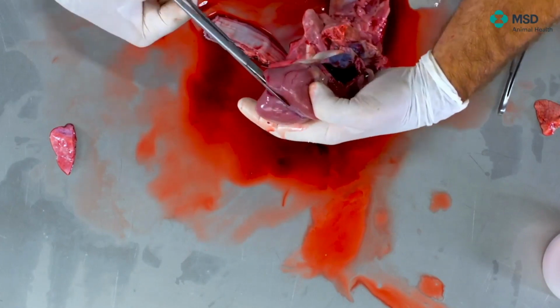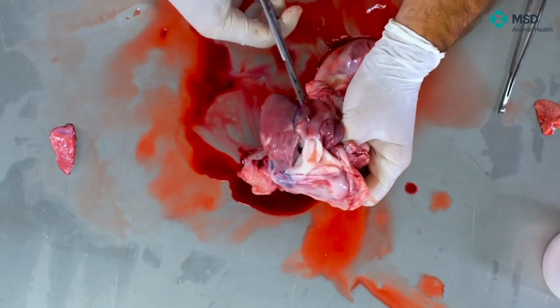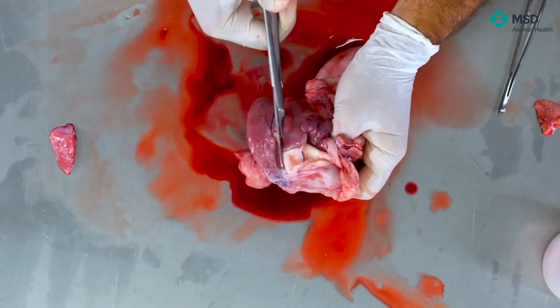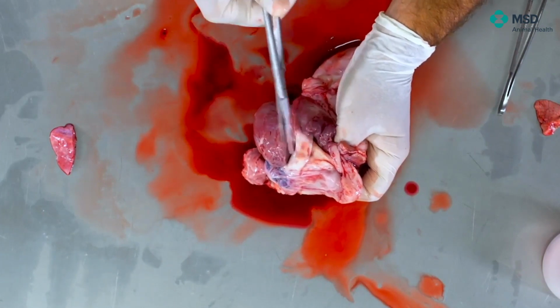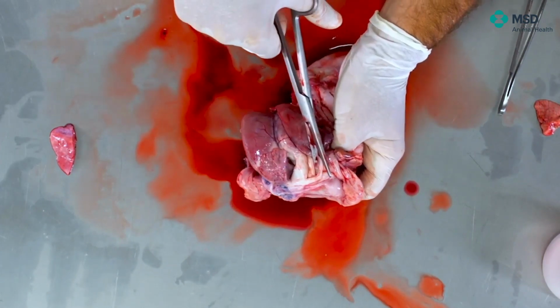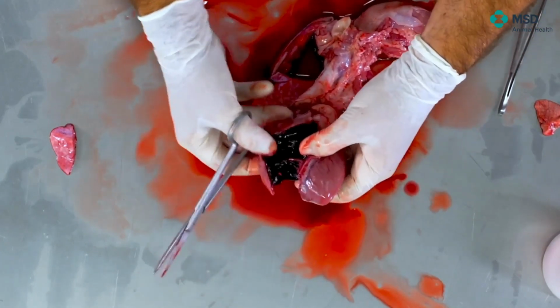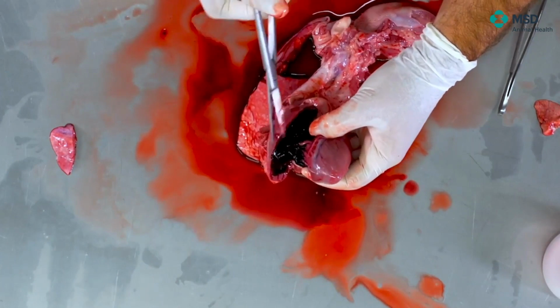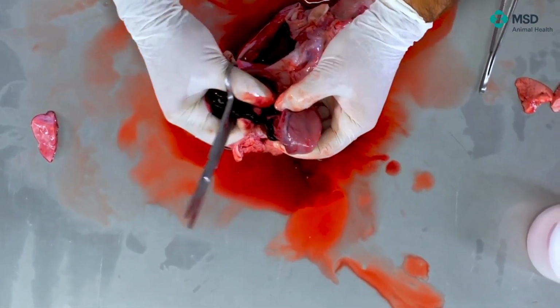until, of course, I'm getting out, as you can see here, by the pulmonary artery, which is perfectly seen here. So by that way, you will see we have opened the heart. There are some papillary muscles that I'm cutting. There's plenty of blood, so we can remove the clots without major problem.